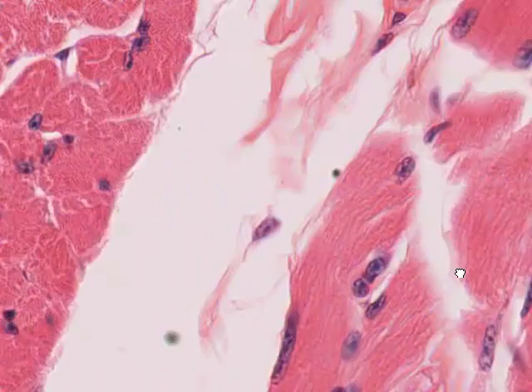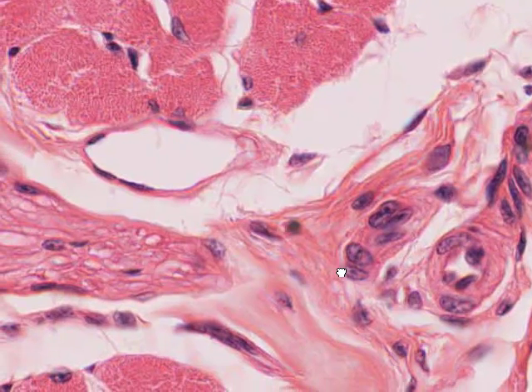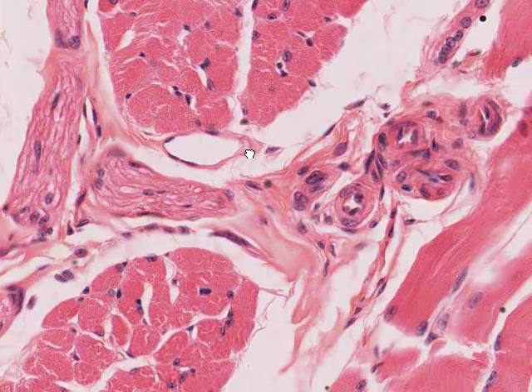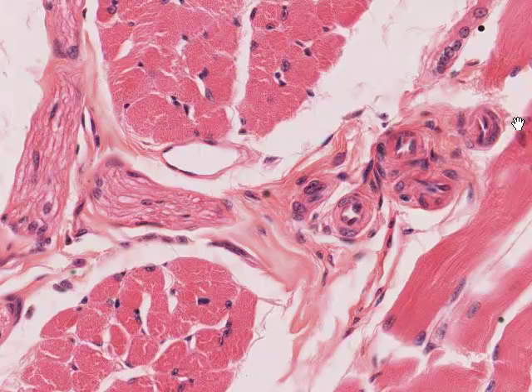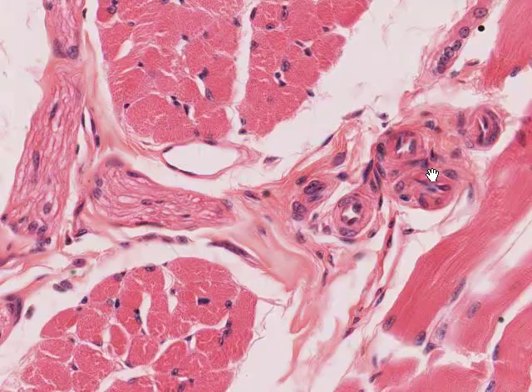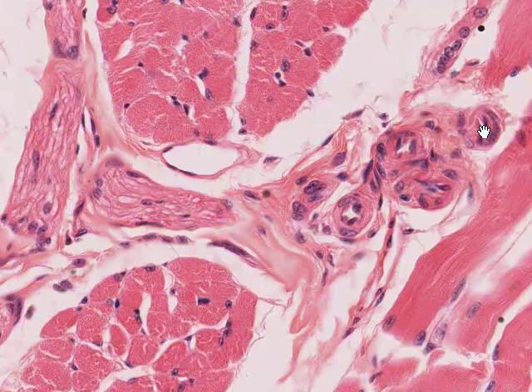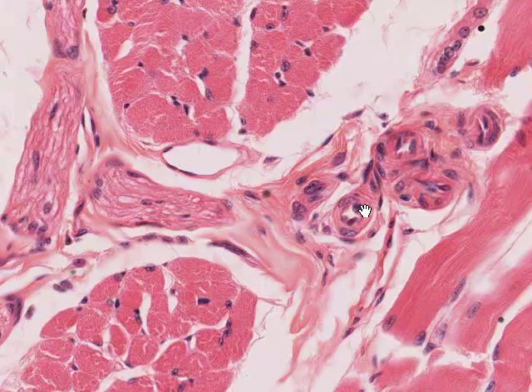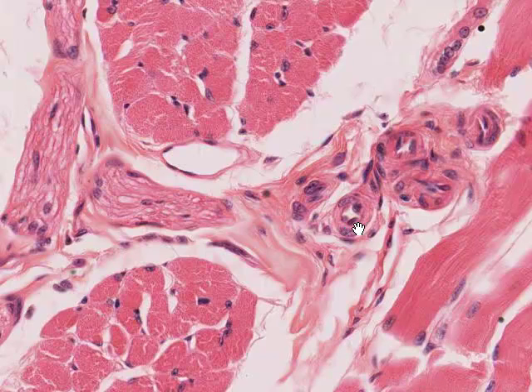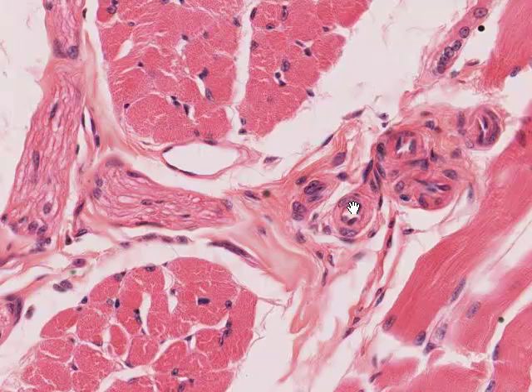At this high magnification it's worth taking a look at that small cluster of vessels and the piece of nerve I spoke about earlier. Reducing magnification slightly: here is skeletal muscle in longitudinal section, here skeletal muscle in cross section, and here we have a little branch point of a small blood vessel — specifically an arteriole. We can see a lumen with the nuclei of at least two endothelial cells, and then just one layer of smooth muscle in the tunica media of the wall.